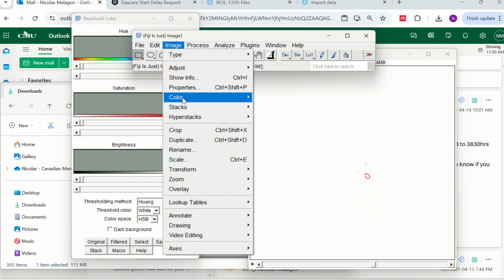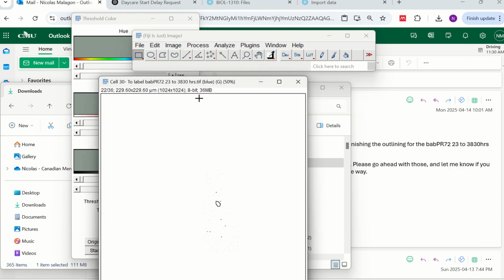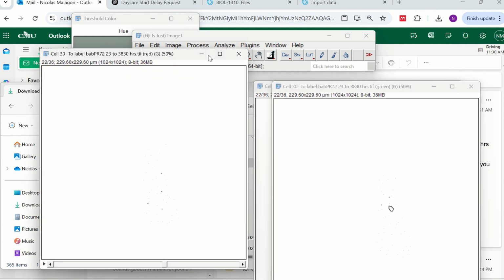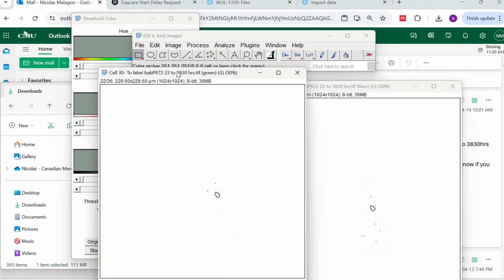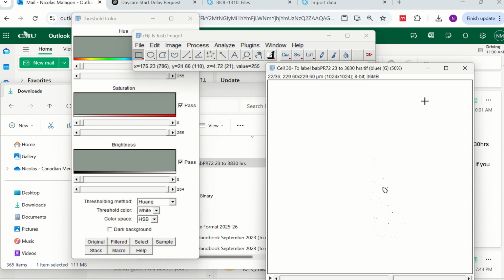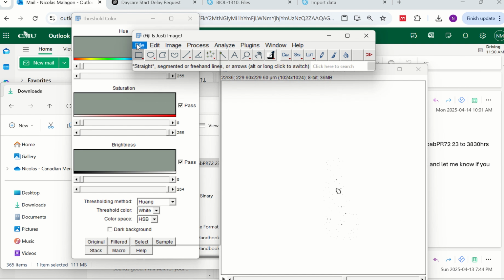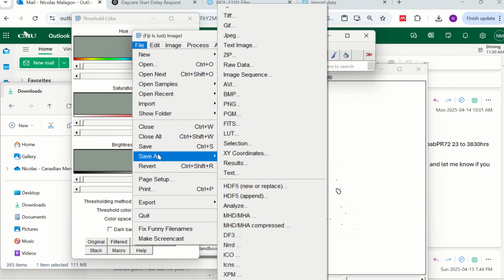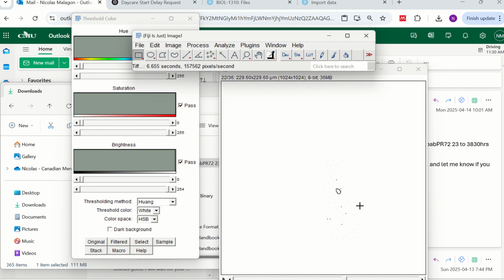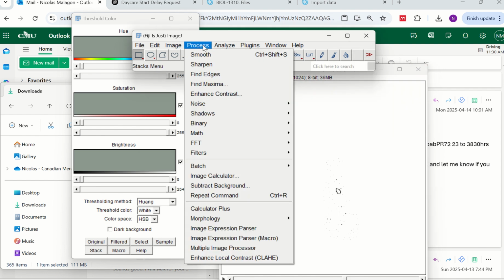Now, as we don't have background, if we go Split Channels, so look, this is blue, this is green, and this is red. Now red doesn't work, and you can keep any of those. Either one of these works, the green one or the blue one. So let's keep either one, it is fine. And here you can save this one again just in case something happened. You can give it a name like split channels or something like that.